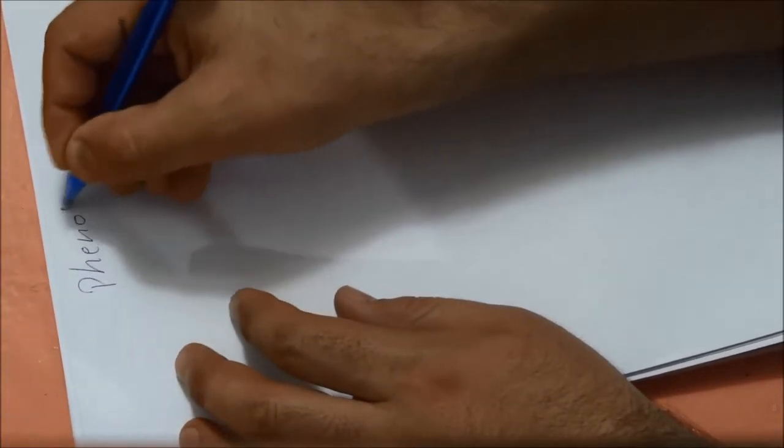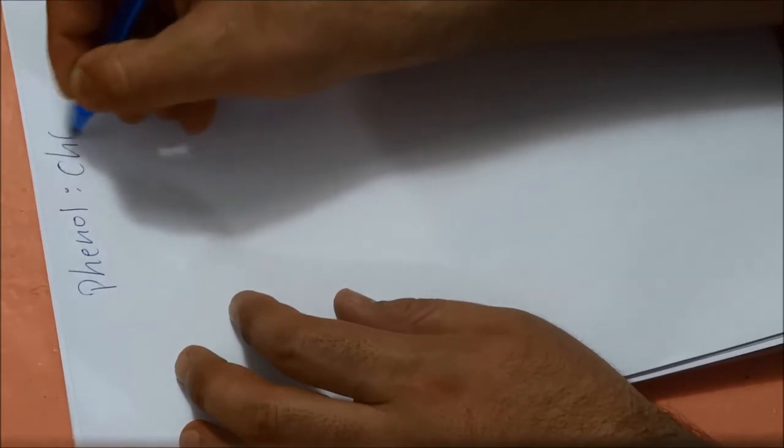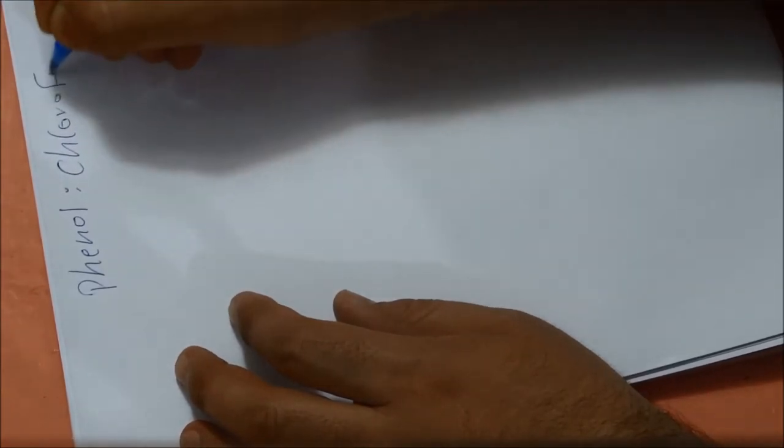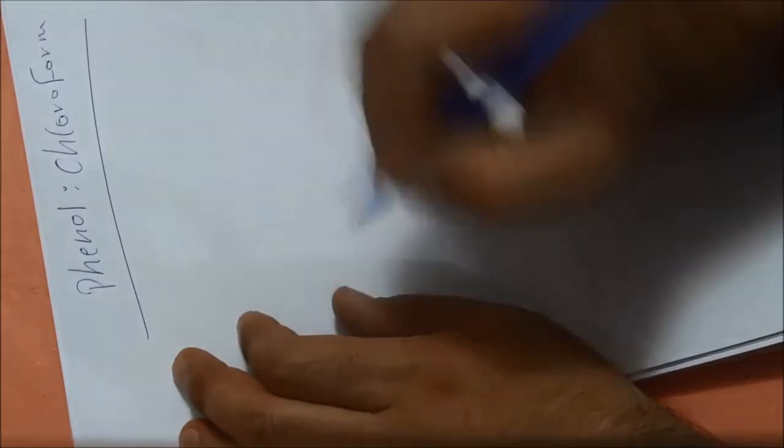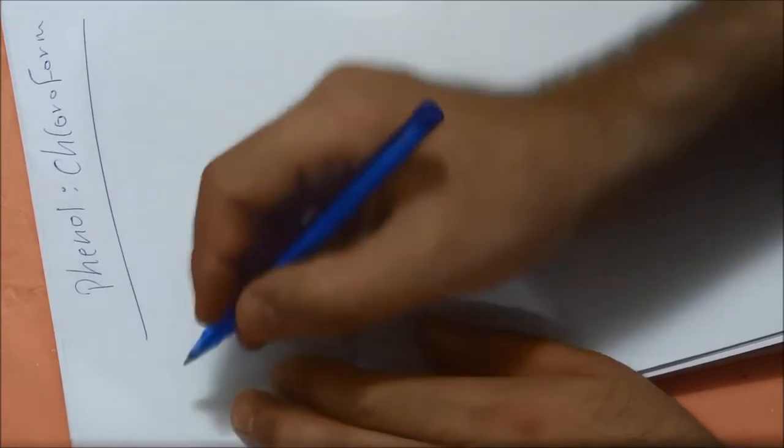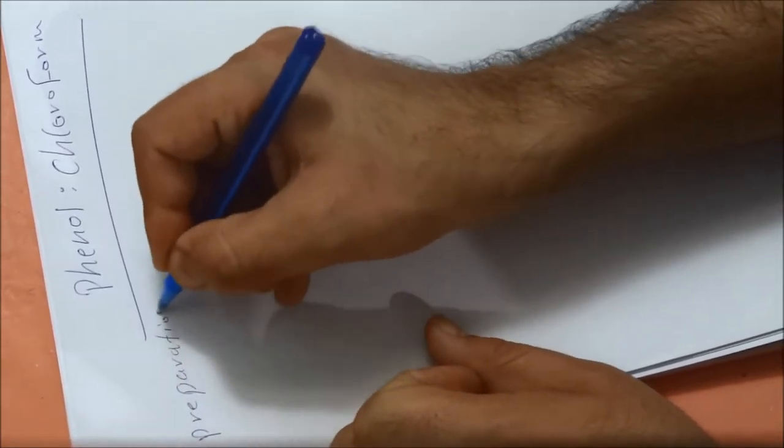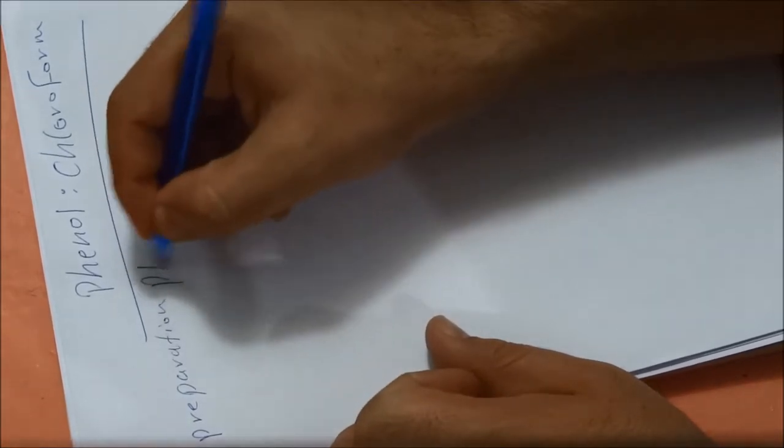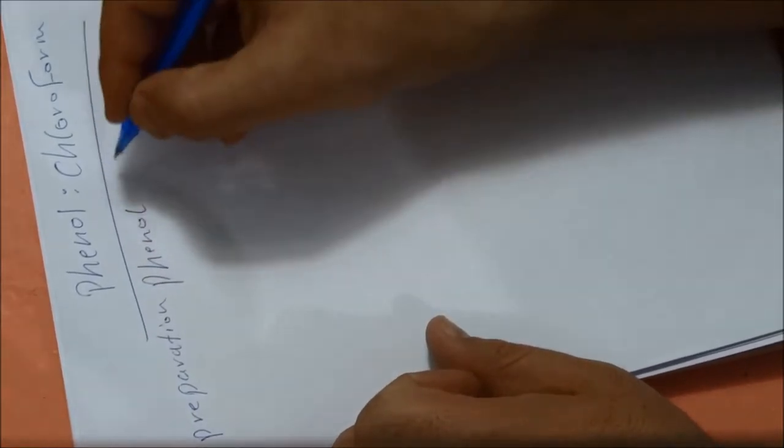It's phenol chloroform. The first step is to prepare phenol solution.